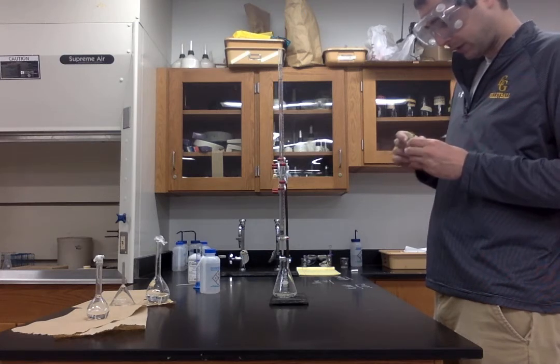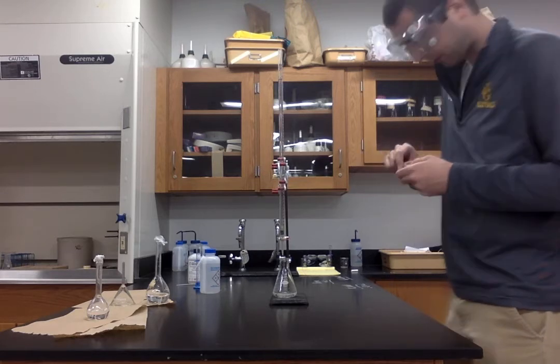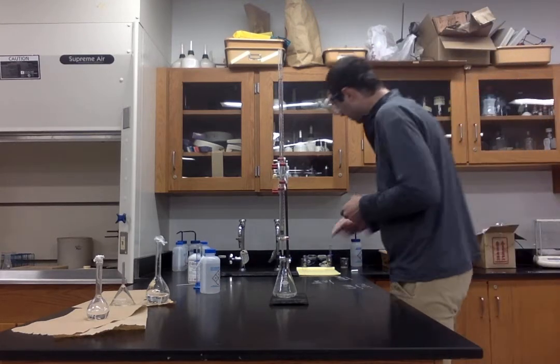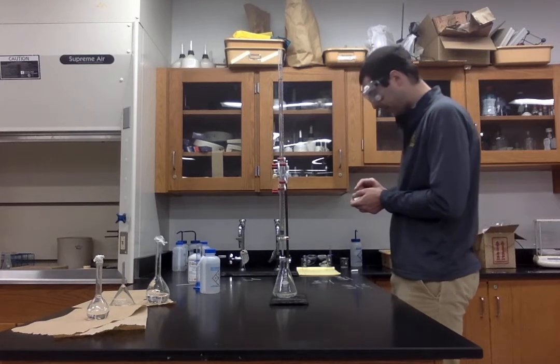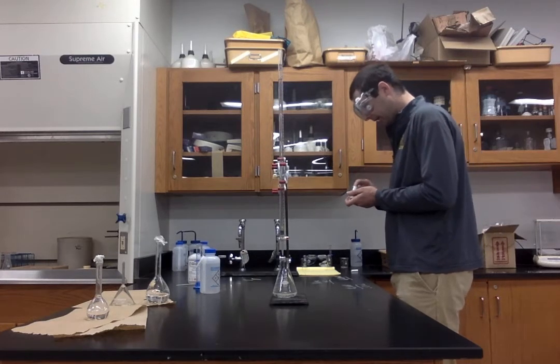They look fairly green to start. The reason I say that is usually they look fairly yellow to start, but that's okay. So I'm just going to grab a bunch and leave them off to the side there, so we can use these as we go.